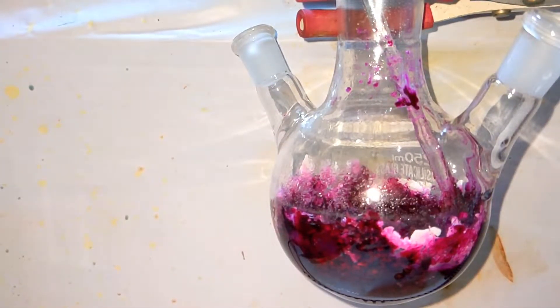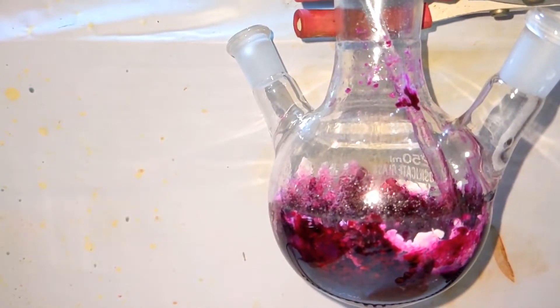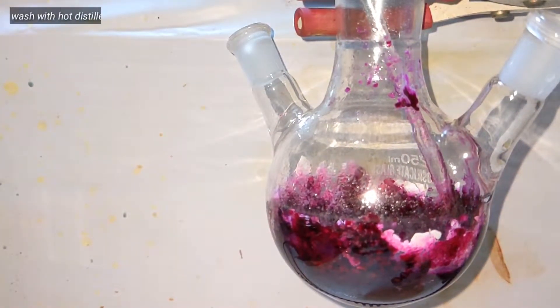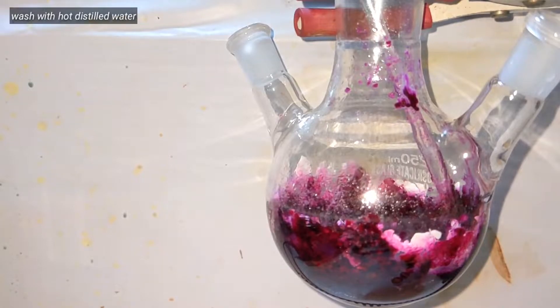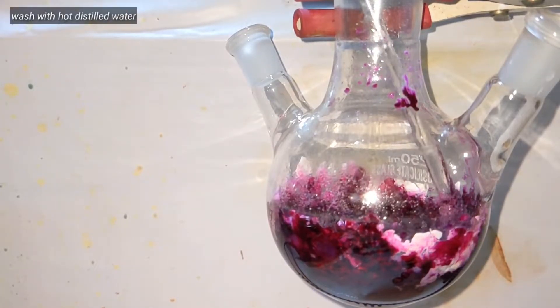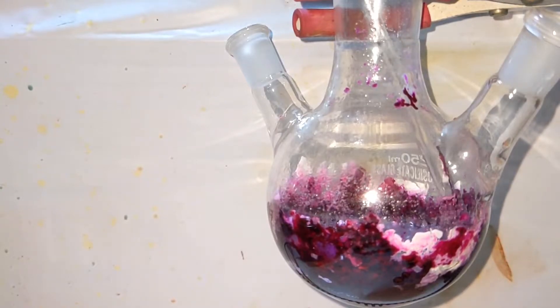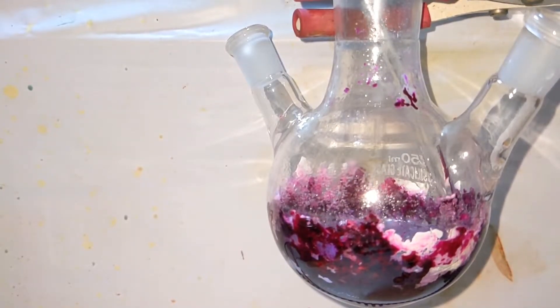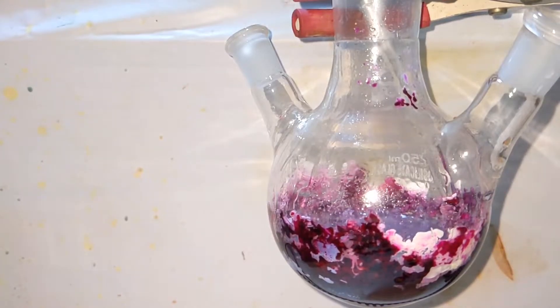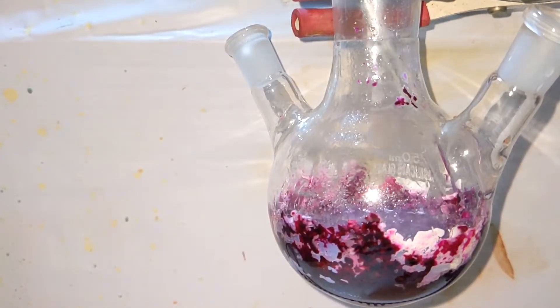After 15 to 20 minutes, the flask was taken out from the heating source and allowed to cool down. You can very well notice the after-effect of not grinding and mixing the reactants at the very beginning — much of the reactants remain unreacted. But let's move on.